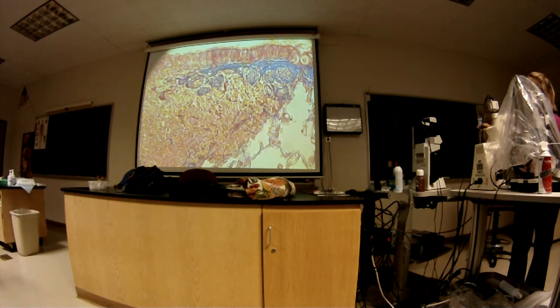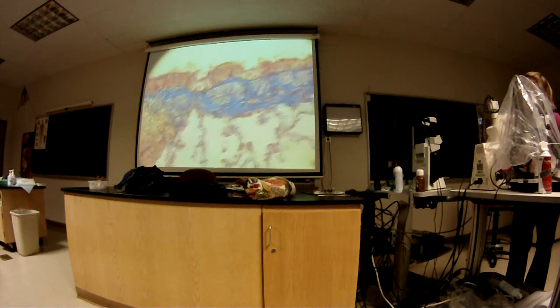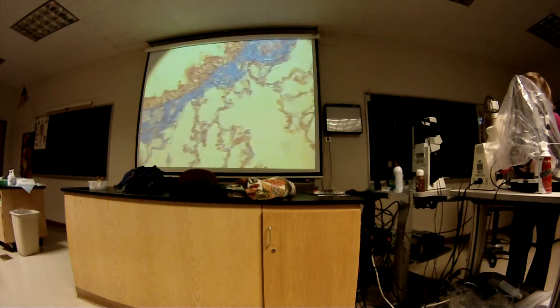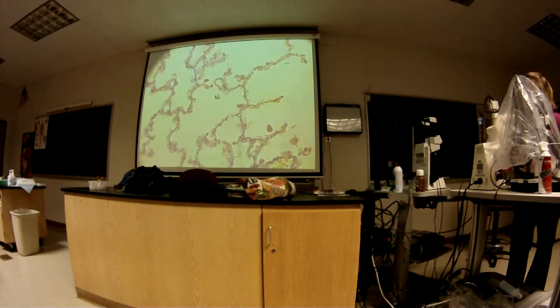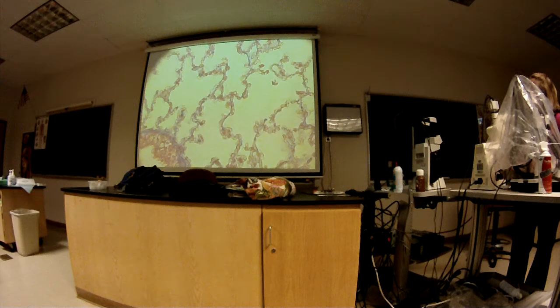And then the purple structure looks like little pockets of hyaline cartilage. And then this is that smooth muscle? This looks like the underlying connective tissue, part of the mucous membrane. Mucous membrane, okay. And what are these? Alveoli. Yeah, alveoli. Okay, interesting. The alveoli are simple squamous epithelium, and then there are closely associated capillaries, and there's a little scattering of extra cells, some specific cells that have specific jobs.